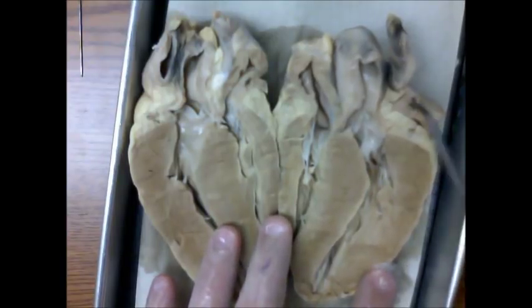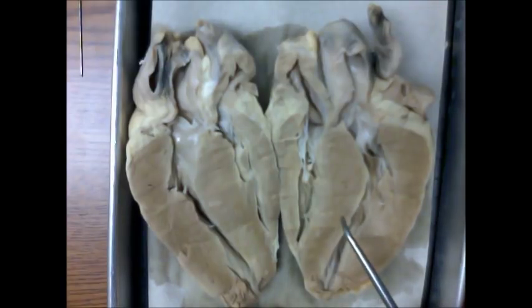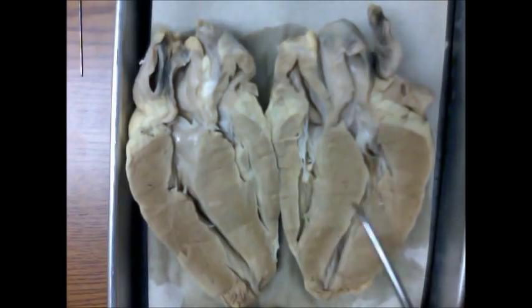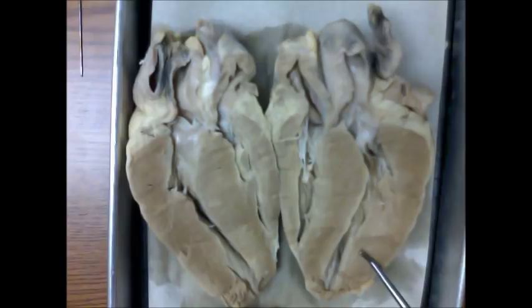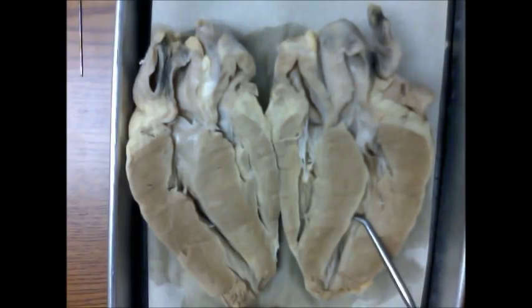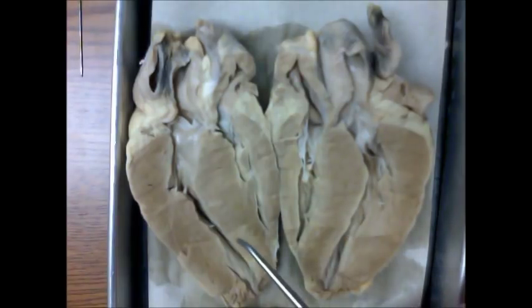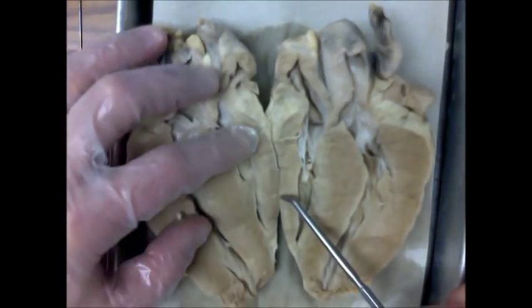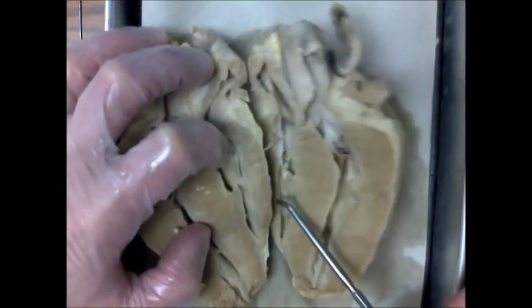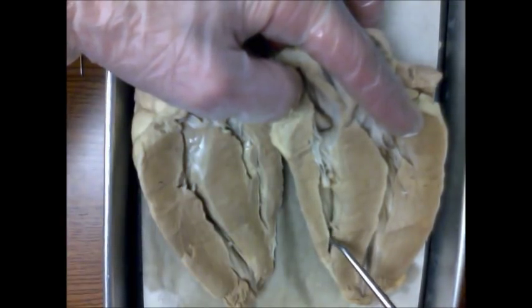Every heart will appear different when cut on a slightly different plane. One of the key distinctions for the internal structures is denoting between right ventricle and left ventricle. The landmark that can be used is the thick myocardium that surrounds the left ventricle. Because this heart has been cut in half and opened like a book, this left ventricle connects to the left ventricle on the other half. The right ventricle has a much thinner myocardium.